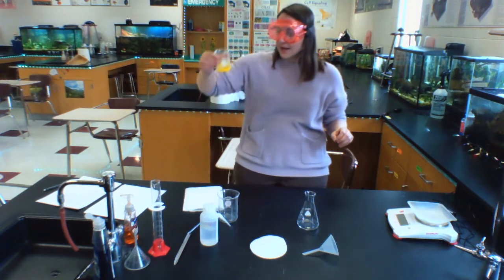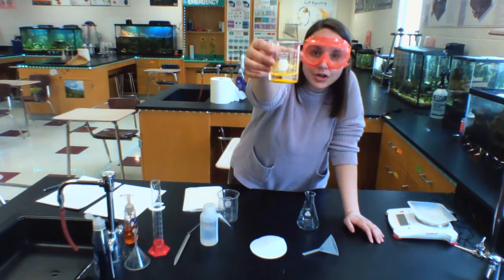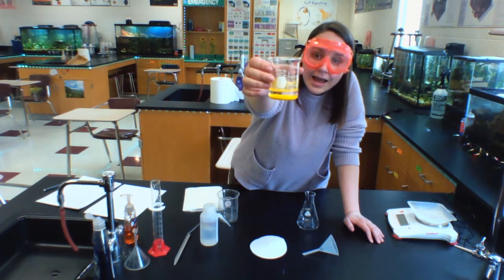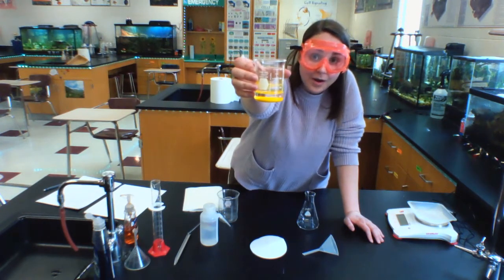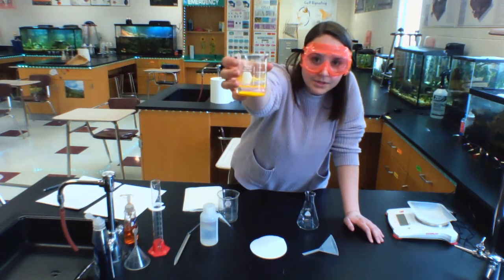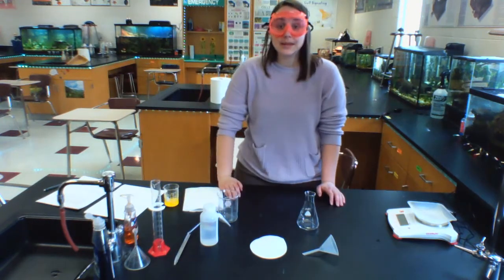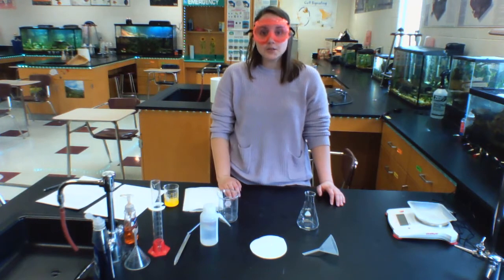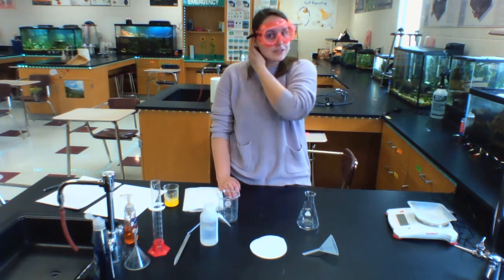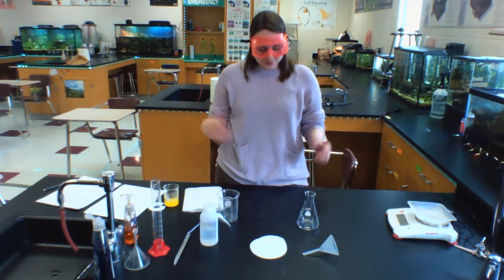So overnight, there was a bit of something going on with this. Yesterday, I had stirred my entire beaker full of our reaction, and it was all yellow all throughout. But now you can see it looks like a layer of water, and then the precipitate has come to the bottom of this beaker. And what I want to do today is begin the process of figuring out how much precipitate was made in this reaction so that then we can think about that in terms of how much reactants we had, how much products we have, and did we get what we predicted.